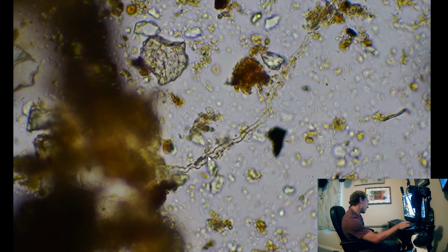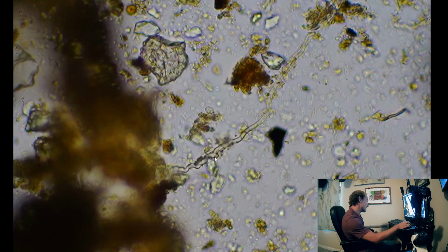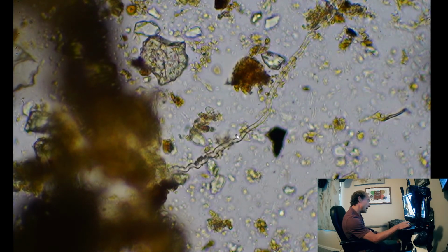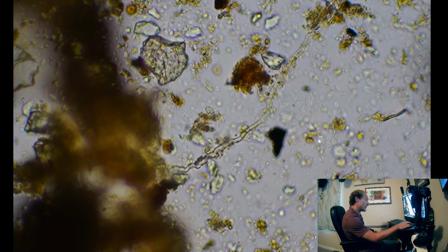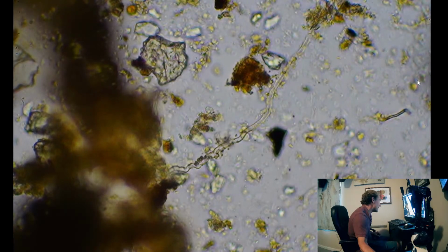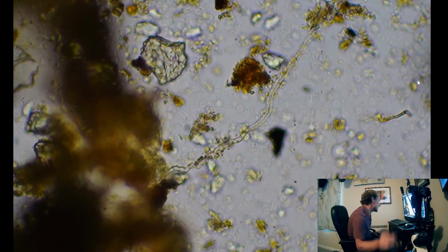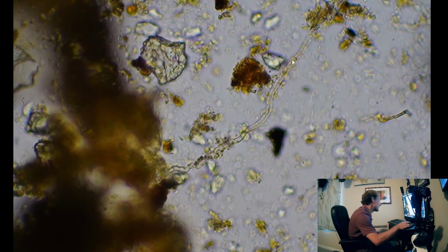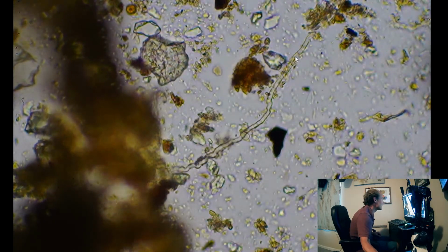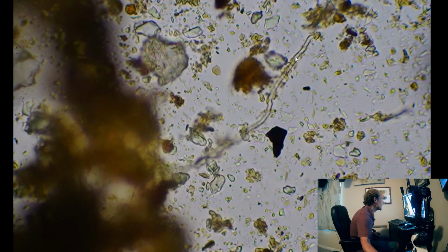But yeah, so that's actually not all that bad of one. And you can see it got kind of roughed up over here and sort of looks ununiform. But it's pretty much the same width all the way through. And yeah, let me point out the very hard to spot septi, but we can see one right here, and I noticed another one, I think, right up over here.